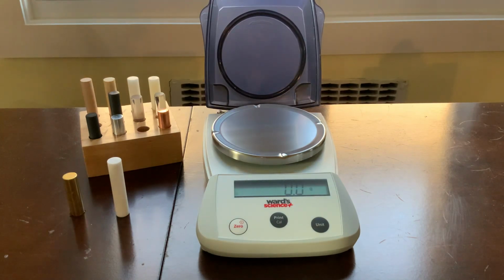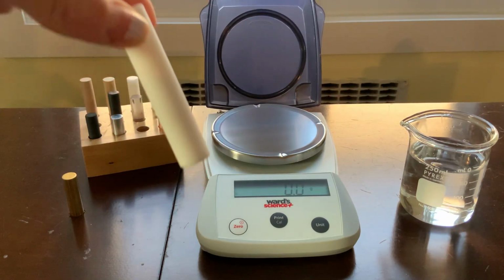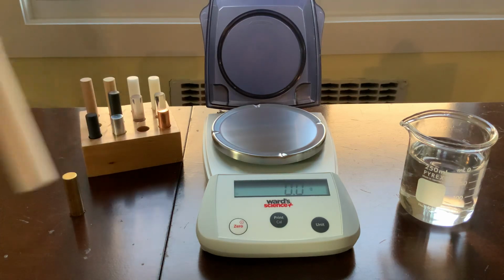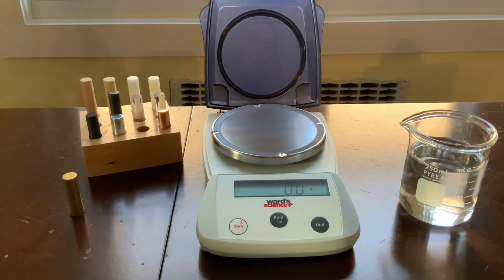Okay. Now let's repeat this experiment for the case of this object. So again, I want you to record, how are we going to find the mass of this object? Let's use the balance. We can see it's been zeroed, and we're going to put it on there. Please record the mass of this object.